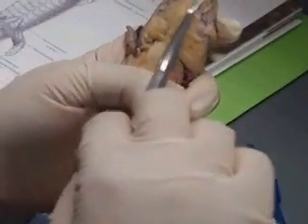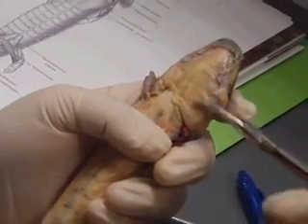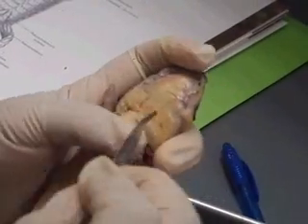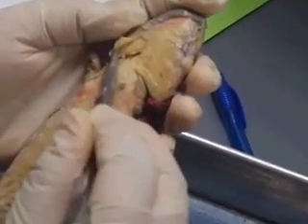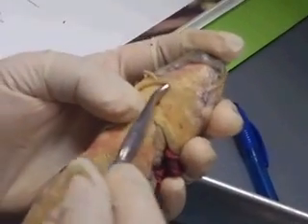What's this muscle? I already told you what it was. Intermandibular. There you go. And what's this bigger one beneath it? Interhyoid. Underneath the interhyoid is... Branchiohyoid. And the geniohyoid in the middle.